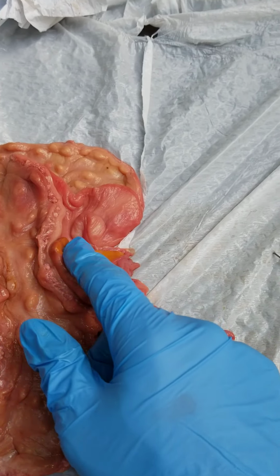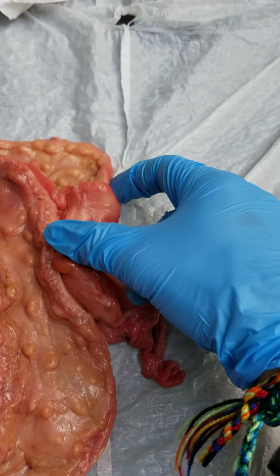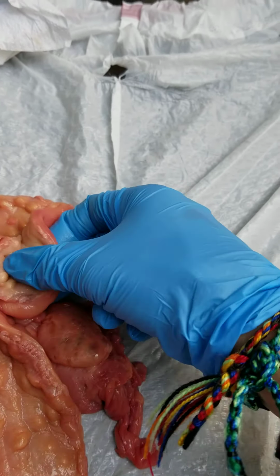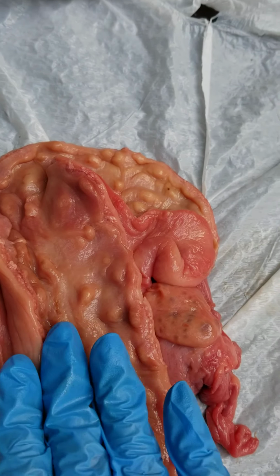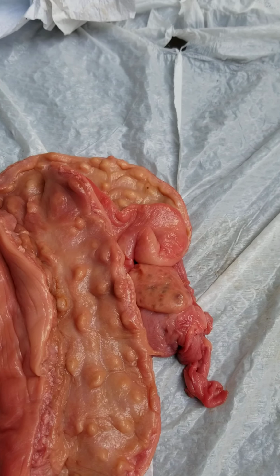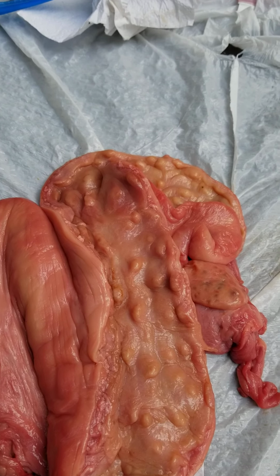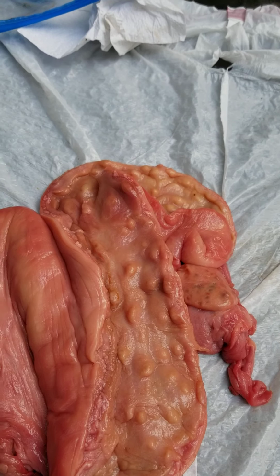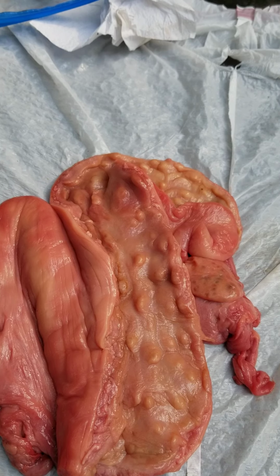Okay, now that we have gone through and looked at our ovary and our oviducts, now we're going to come up here to our connection point of the uterine horn and now look at our bifurcated uterus. Bicornuate uterus, sorry, which means that it has poorly developed horns, which is different than the simplex uterus, which has basically no developed horns, and then the duplex uterus has two cervices.